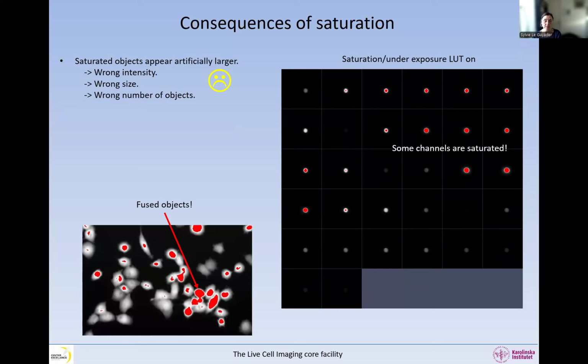So it depends, because those that are far away from each other, we're going to count them properly. If we just count and we don't look at the intensities, they are definitely wrong. But if they're close to each other, then you're going to get the wrong number of objects. So keep the saturation and underexposure LUT on all the time, and then set the parameters to have no saturation in the area of interest.